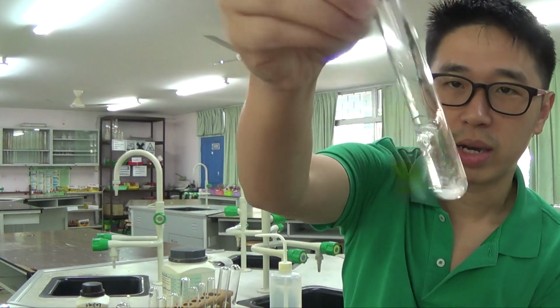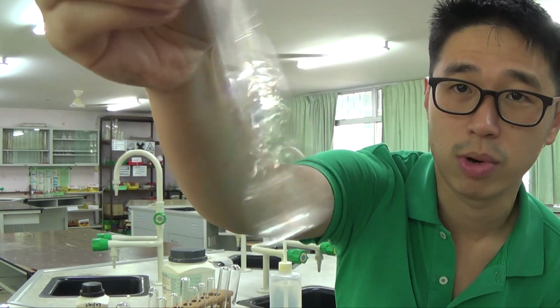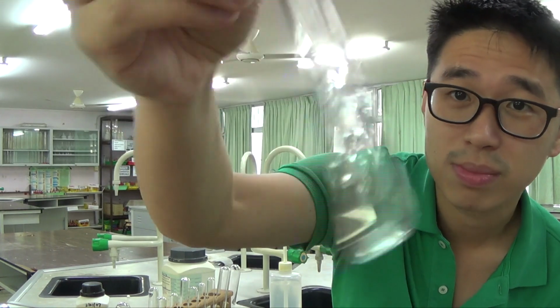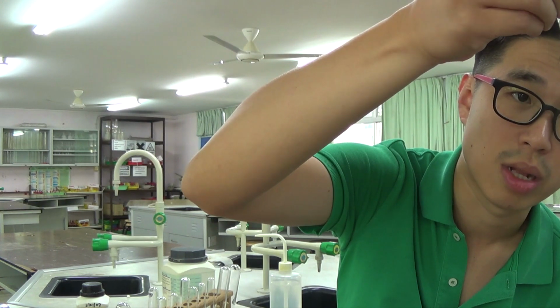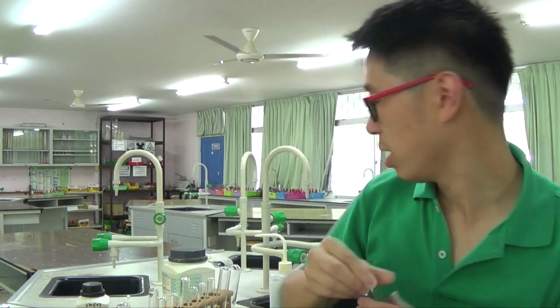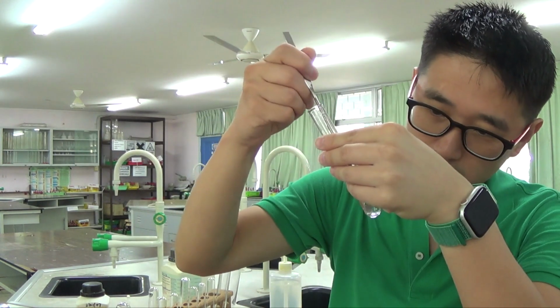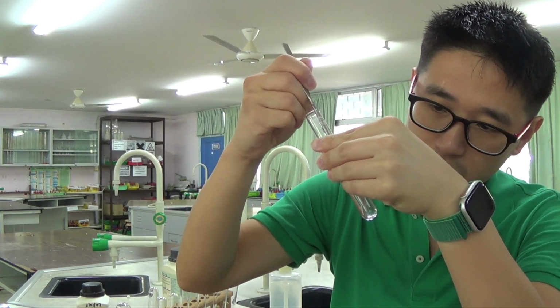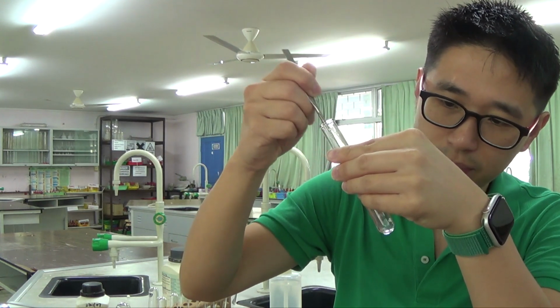So this was ammonium carbonate. All ammonium salts should be soluble in water. In fact, you can see they are starting to dissolve already. Probably not everything, but I'm going to try and swirl it so that they all dissolve. There's a big chunk of the solid at the bottom. That was because I added in a bit of the solid, so I'll try and break up the solid, and they should all dissolve because all ammonium salts are definitely soluble in water.